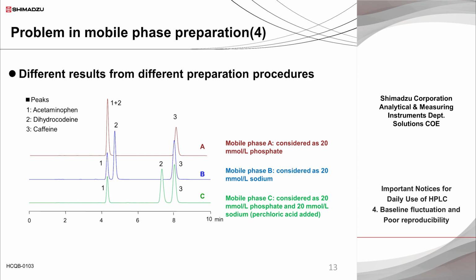at a pH near the pKa1 of phosphoric acid, half of total phosphate molecules are dissociated, having monovalent negative charge in the mobile phase. The dissociated monovalent phosphate ions form ion pairs with dihydrocodeine with a positive charge. In chromatogram A, the retention time of dihydrocodeine overlaps that of acetaminophen, but in chromatogram B, as explained above, the concentration of phosphate buffer is approximately double that of A, and the concentration of monovalent phosphate ions is also larger, resulting in a larger ion pair formation rate with dihydrocodeine.